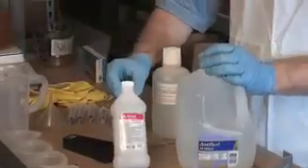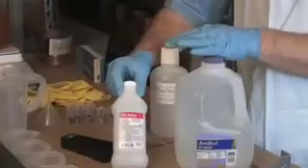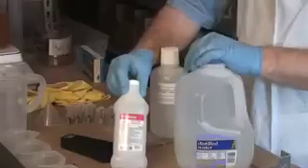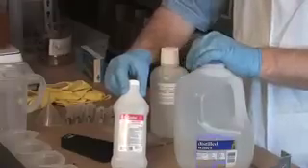You're going to need some isopropyl alcohol. It's important that it's isopropyl and not methyl alcohol. I like to get as pure as I can — this is about 91% isopropyl alcohol from the local grocery store.